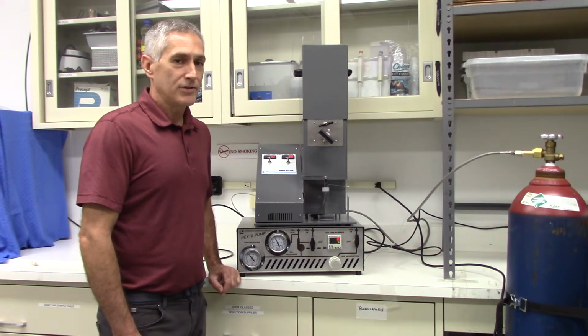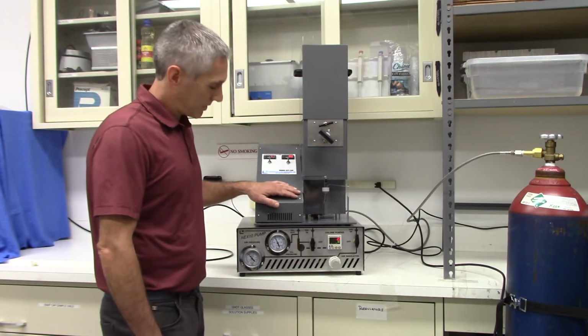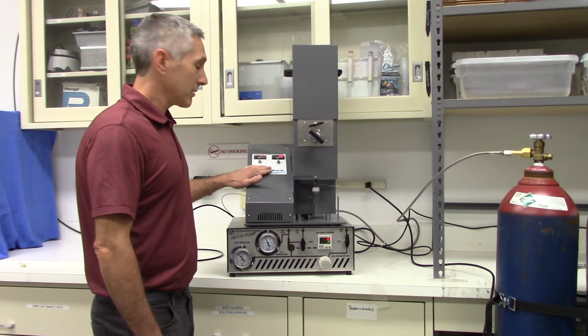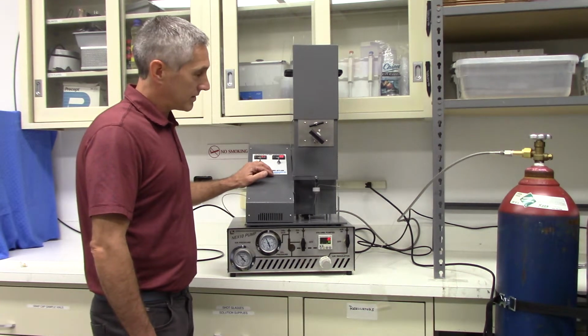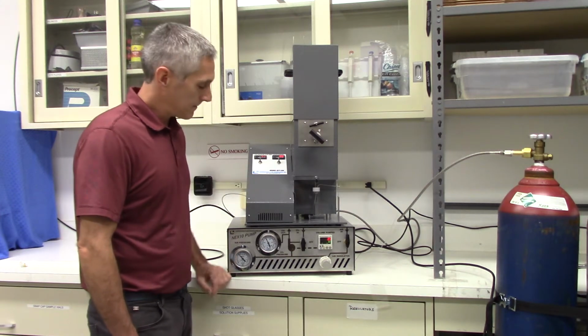Alright, so now we have generated pressure with the Nex10 pump into the SFT-120. We're sitting at about 4,000 psi. Our heat is stabilized. We are in a static position. We are ready to start flowing dynamically.